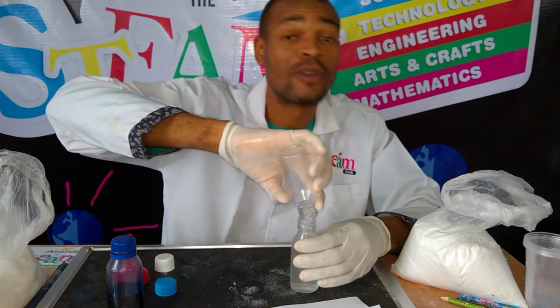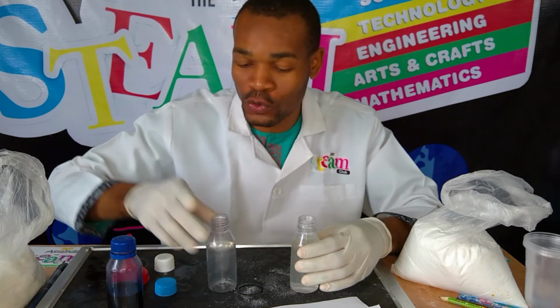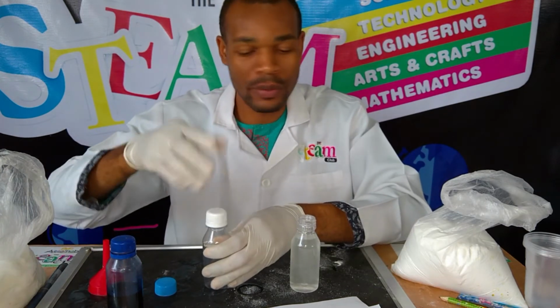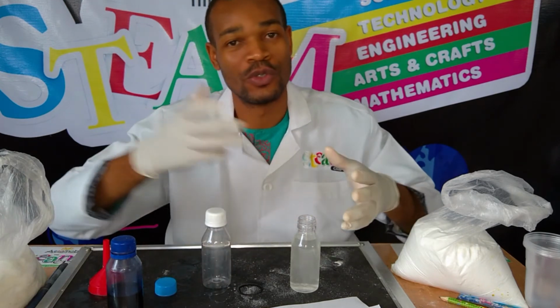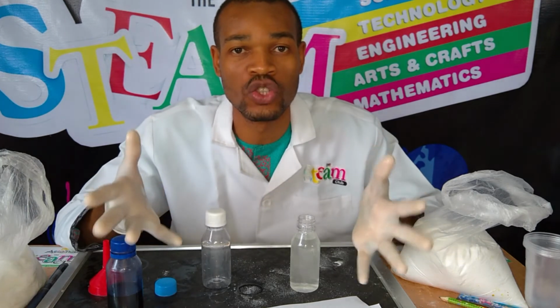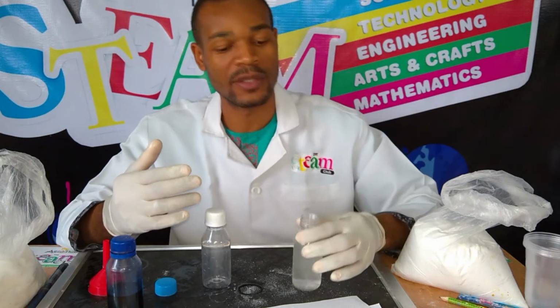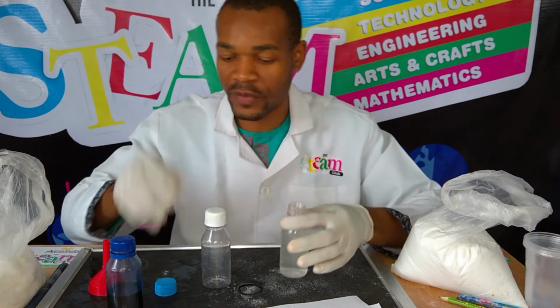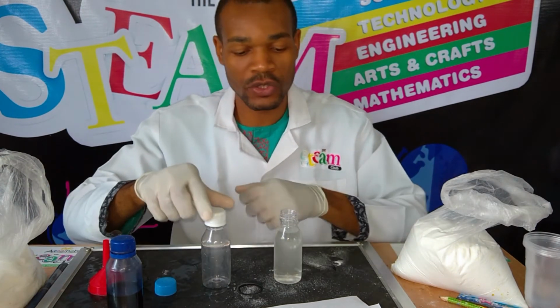One thing I love about chemistry is that when you mix two solutions together, they just mix up. You really don't need to do so much, especially if they are liquids. You need to shake them if it's solute dissolving in solvent. But when they are two solvents mixing together, I need not shake it because everything just goes in there and they mix up.